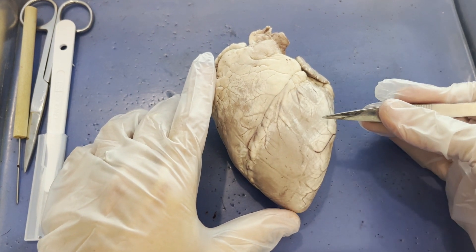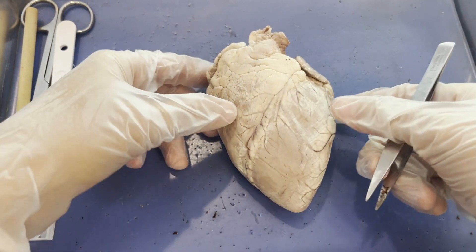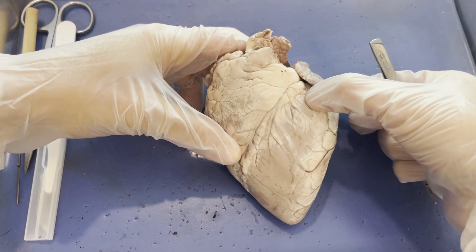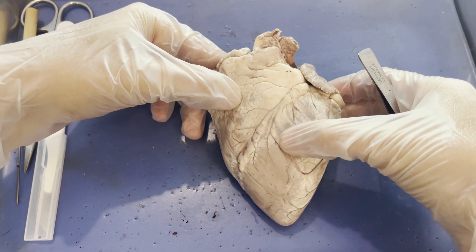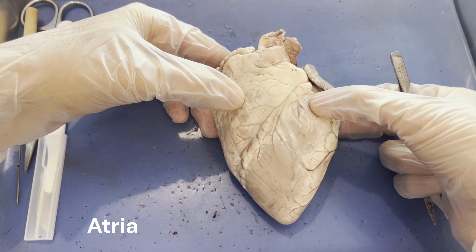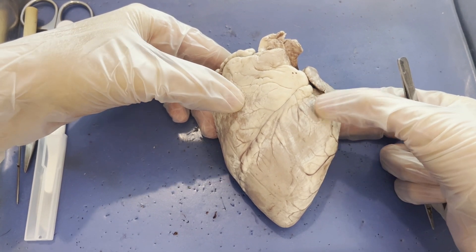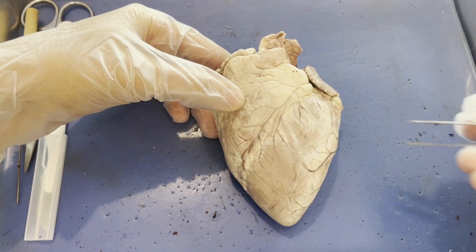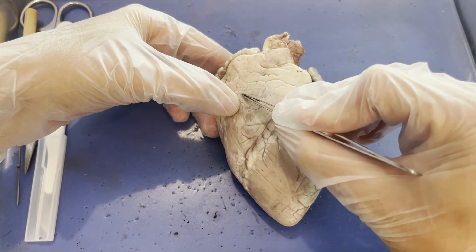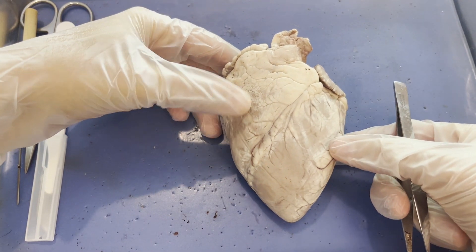Your heart has four chambers, and so does a sheep's heart. The upper chambers — located up here and here — are the left and right atria. In a fancy building the atrium is usually the entrance, so the atria are where blood first enters the heart. The left atrium receives blood from the lungs. The right atrium receives deoxygenated blood from the body, coming from the superior and inferior vena cava.